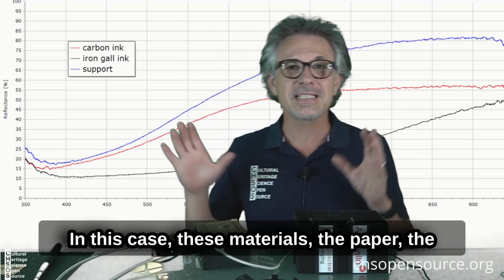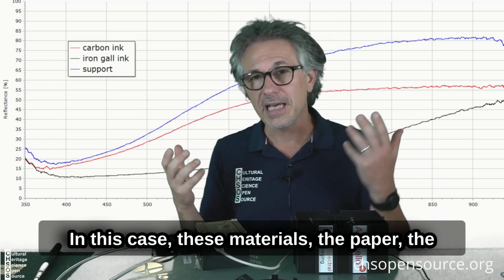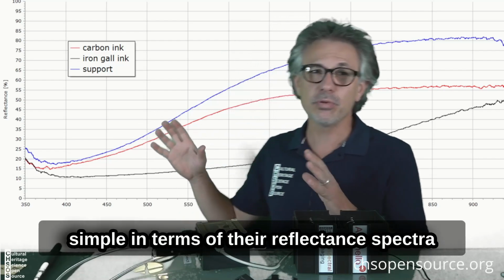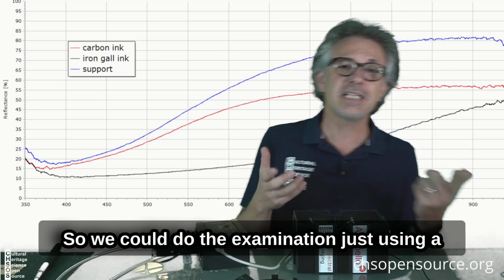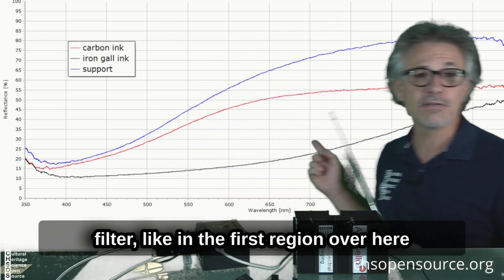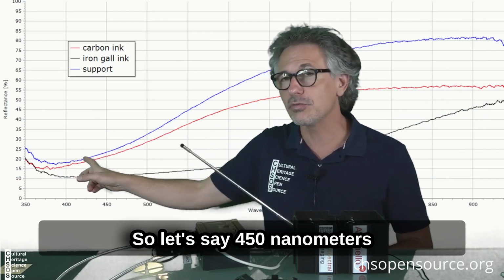In this case, these materials, the paper, the iron gall ink and the carbon ink, are very simple in terms of their reflectance spectra. So we could do the examination just using a filter like in the first region over here, so let's say 450 nanometer.